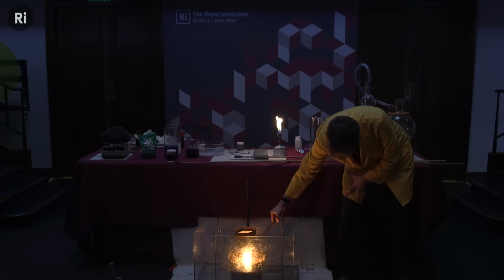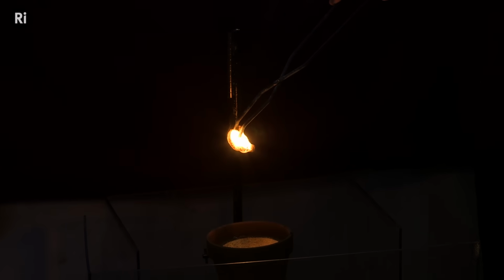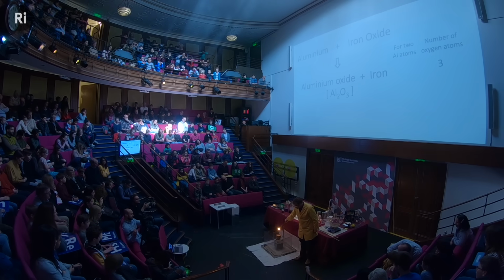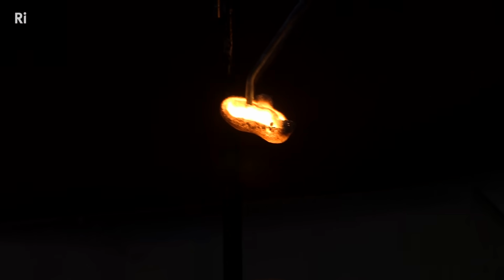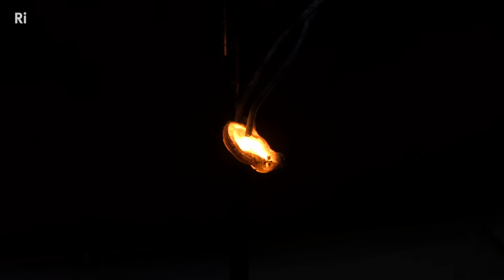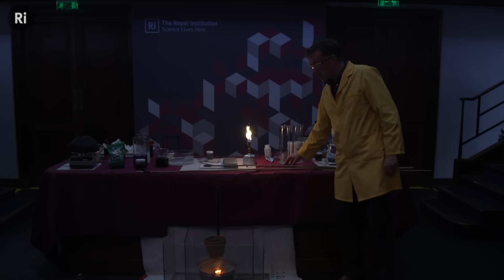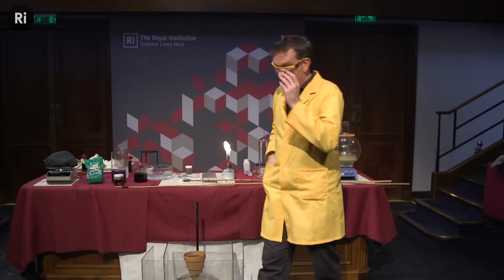This reaction generated so much heat, and that heat came from the reaction of the aluminium reacting with the oxygen from the iron oxide, that it actually produced molten iron. So this reaction is known as the thermite reaction, okay? And it generates so much heat here, it actually liquefies the iron that's made, and so that was molten iron coming out the bottom, and it's still red hot. This is actually very useful. This could be used to make liquid iron, molten iron, when it's needed in rather inaccessible areas. So for instance, in the construction of railways, you can use this to make molten iron to weld the tracks together. Okay, incredibly violent reaction, leaves us with molten iron, but it's driven by the strong bonds between the aluminium and the oxygen there, forming aluminium oxide.